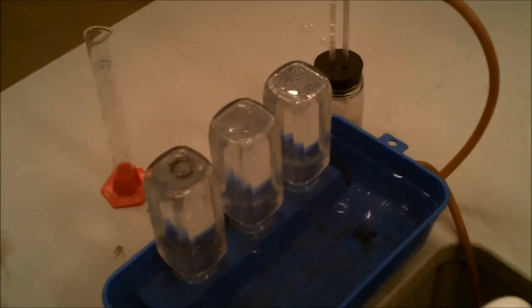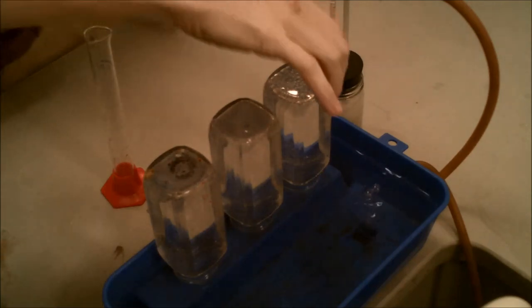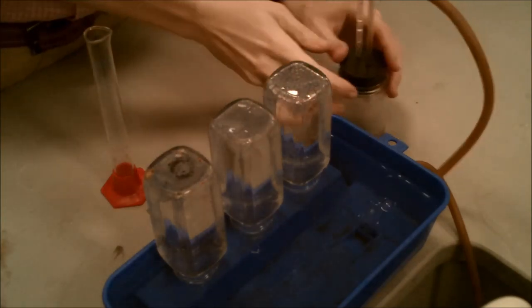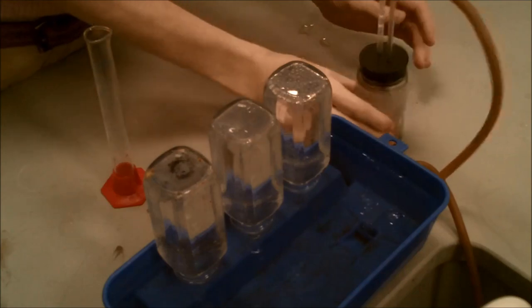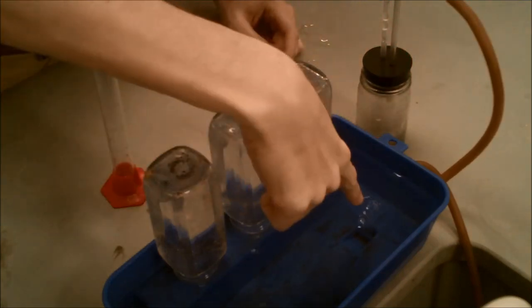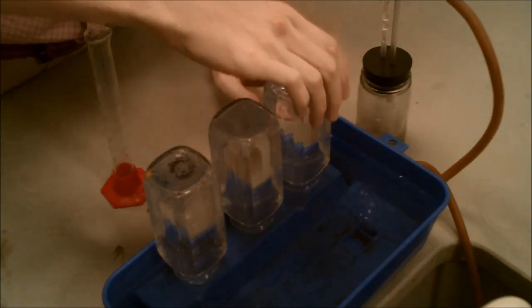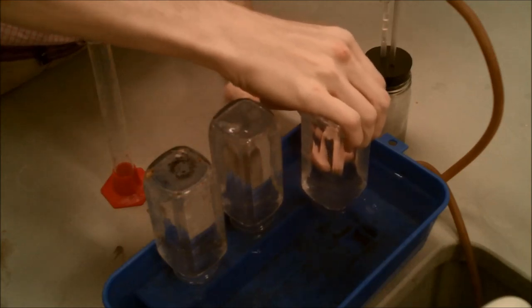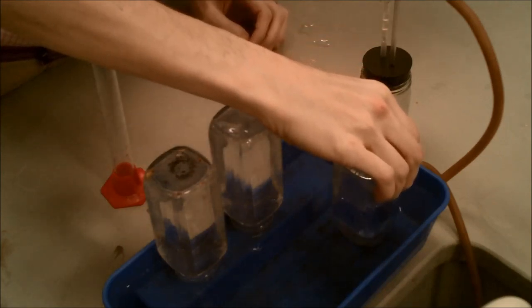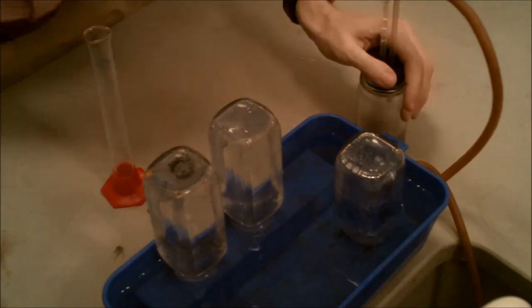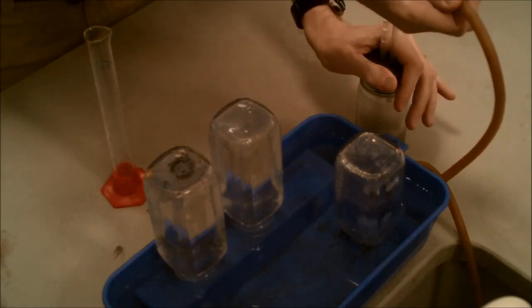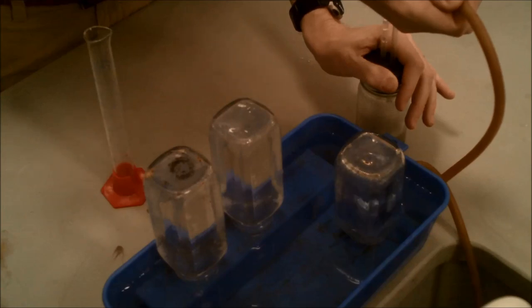That hydrogen gas is being forced through the glass tube, which is then pumped through the rubber tube to the bottom of the trough, which then bubbles up. So our hydrogen gas is being produced in the reaction chamber, passed through the tube to the bottom. And now we're going to use our collection jars to collect it. So we move the collection jar over the bubbles, and the bubbles will go into the chamber, and will force the water out, and we'll have a chamber, or a container, completely filled with hydrogen gas.